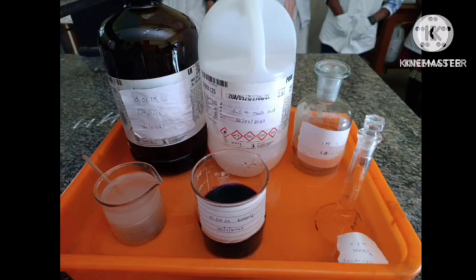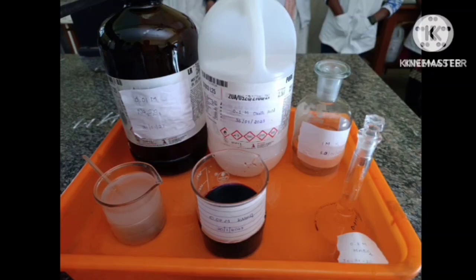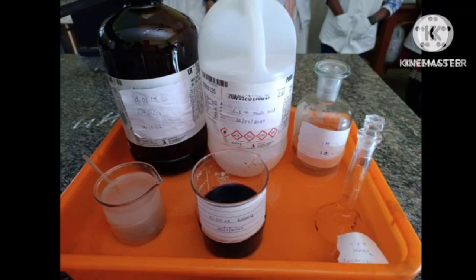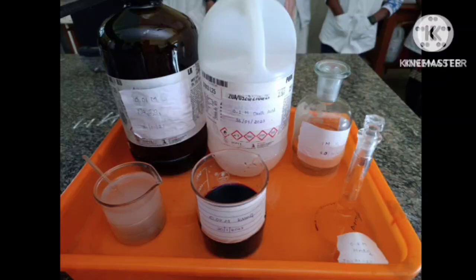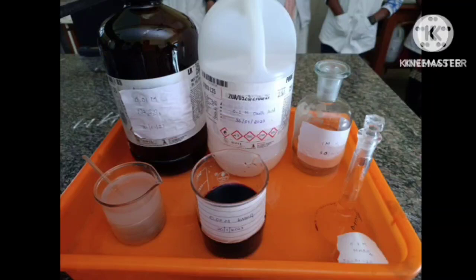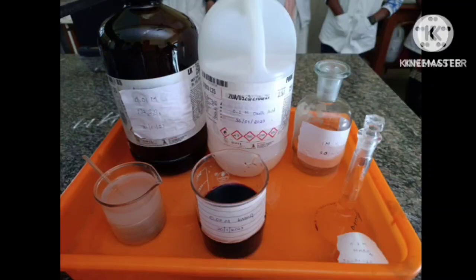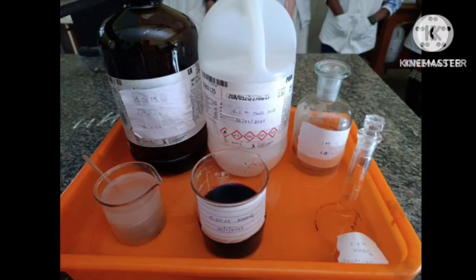The reagents required for this experiment are 0.01 molar sodium thiosulfate, 0.1 molar oxalic acid, 1 molar sulfuric acid, 0.2 molar manganese sulfate, 0.02 molar potassium permanganate, and starch indicator.